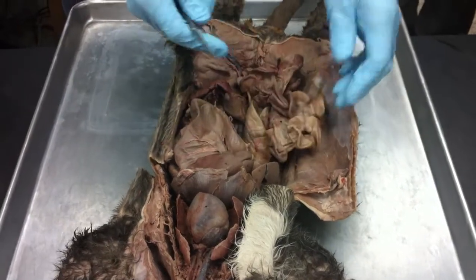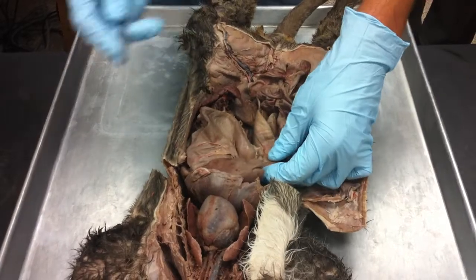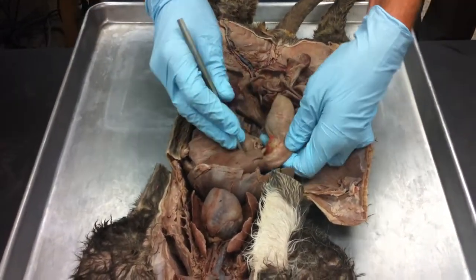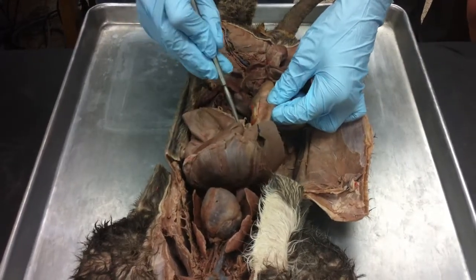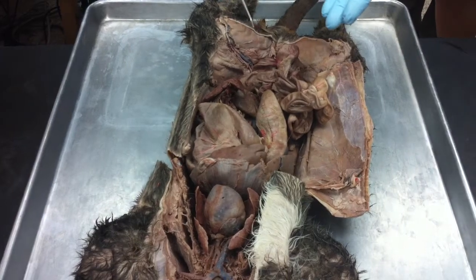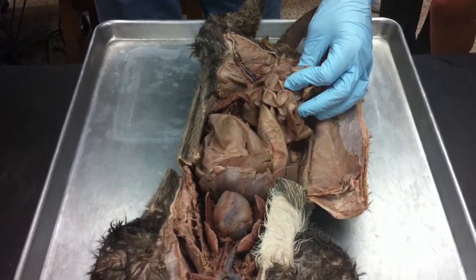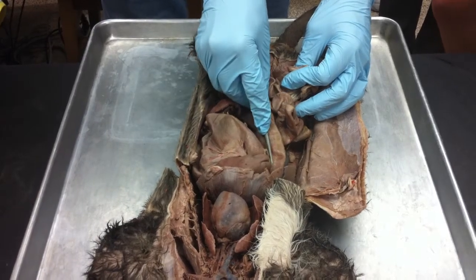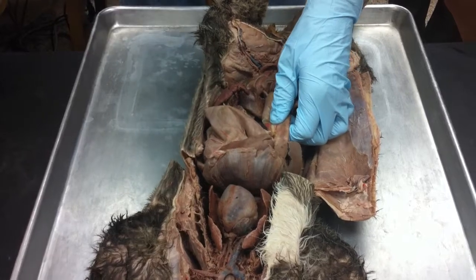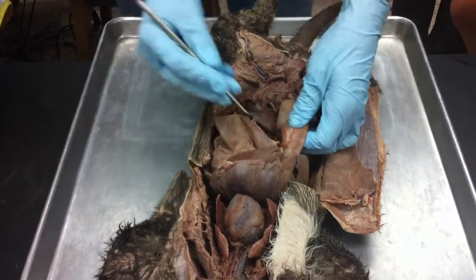So the small intestine is divided into 3 different sections. The first section is called the duodenum. Some people say the duodenum. I used to say the duodenum, then I switched to the duodenum because I thought that's kind of cooler. But anyway, okay. So that first part's the duodenum. So the jejunum is going to be in there somewhere. But just identifying it here on the cat, I don't know. You probably have to know exactly how long the cat duodenum was, and then try and decide whatever. We're just not going to worry about that in here. But just know the jejunum is that middle part of the small intestine. Know that for the practical.